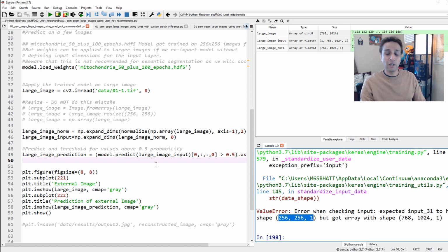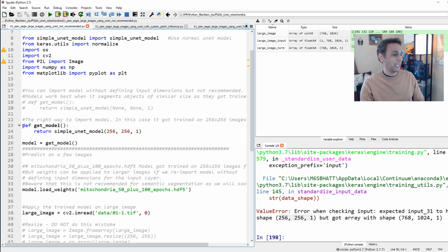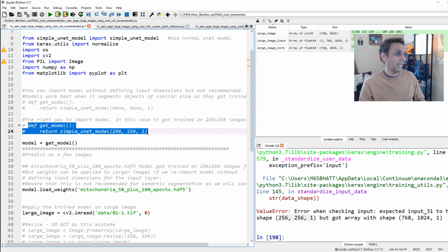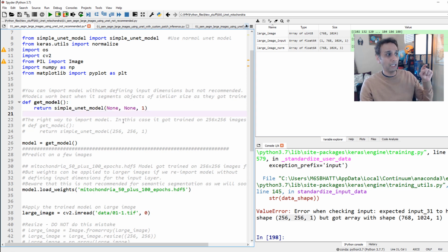But what I have seen online is that people make this mistake I'm talking about. Instead of 256, let me comment this out and uncomment this part. You know that you can define a model input by not giving the dimensions, right? You don't have to give width and height. And we do this in transfer learning when we want to get the structure of VGG16 so we can train it ourselves. But don't make the mistake of importing it this way and using pre-trained weights to do inference or to do your segmentation. And you'll see why in a second.